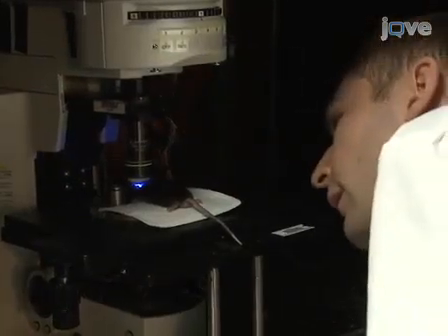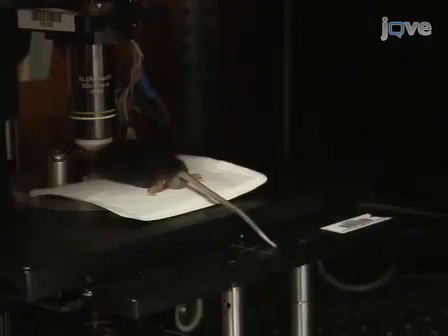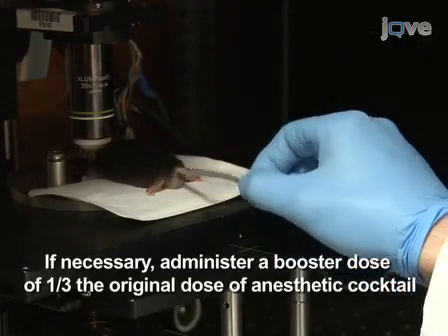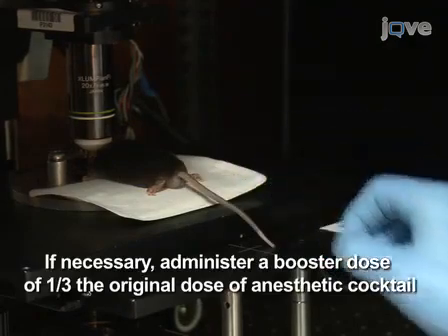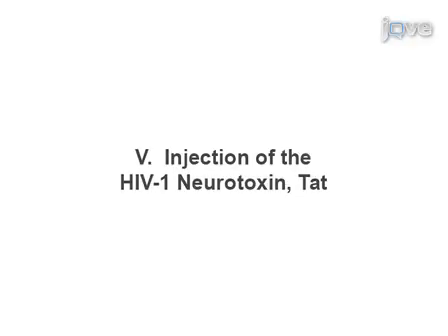Between acquisitions of z-stacks, verify the level of saline and the depth of anesthesia. If necessary, a booster dose of 1/3 of the original dose of anesthetic cocktail can be given during the procedure.